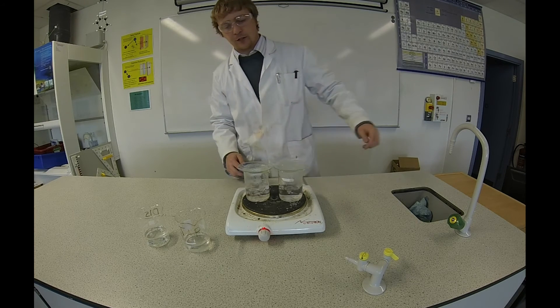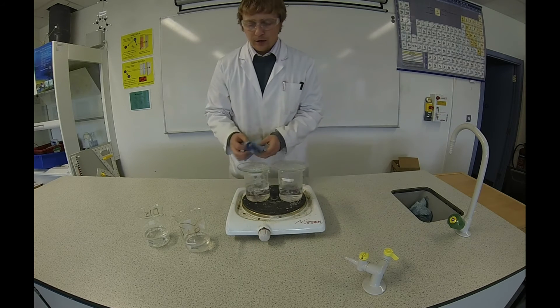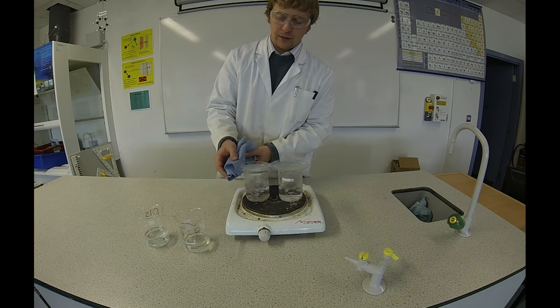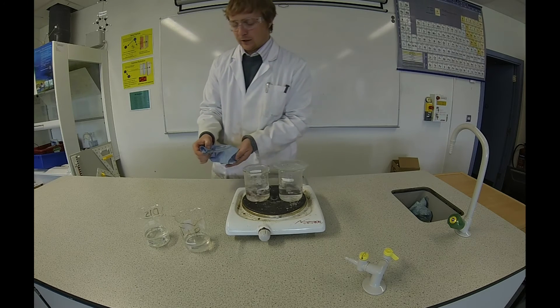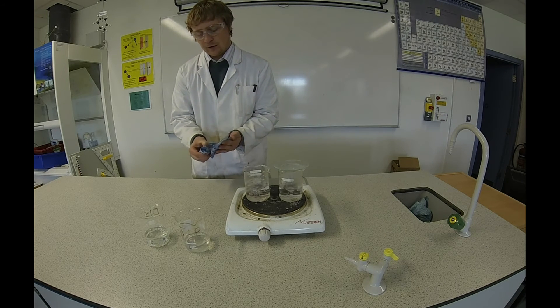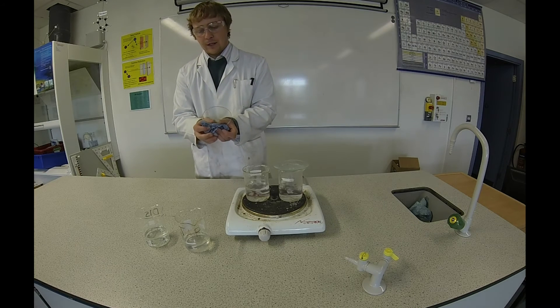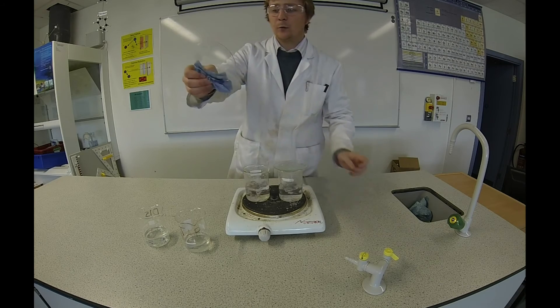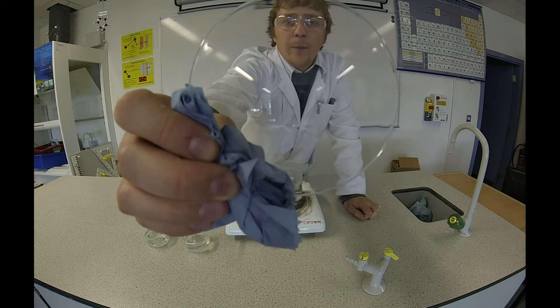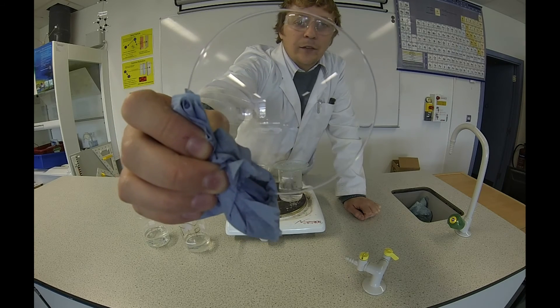So we're going to take a look at the results. Let's turn that off. The first one was the distilled water. I'm just going to use this blue towel because it might be quite hot, and I'll dry off the bottom. Now you can see there, the distilled water had no dissolved substances in it — there's clearly nothing left on that clock glass.